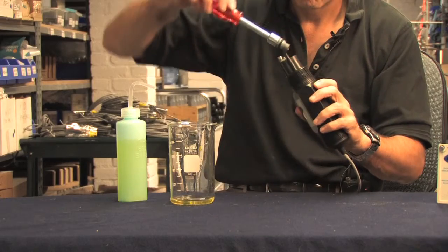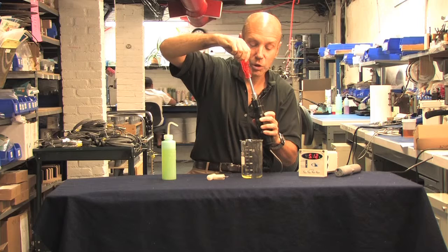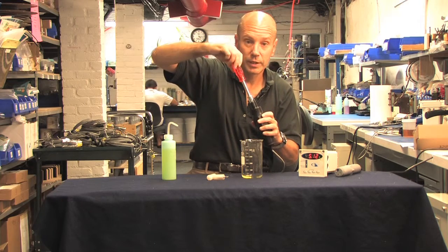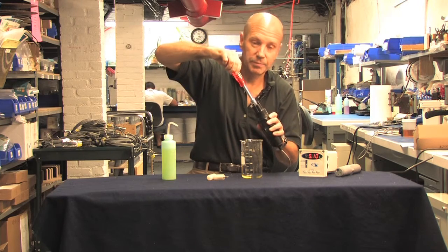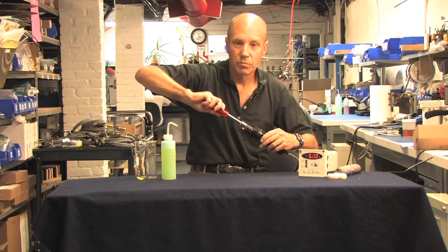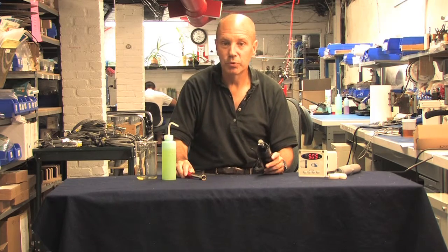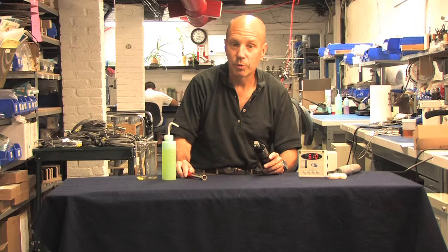What can happen is that the hydrostatic pressure of the salt bridge screwed against the liquid will cause the reference electrode to break, and that's going to make you cry. Screw the salt bridge in about hand tight and you're done. Now that you've changed the solution, you'll need to recalibrate the probe. If you need a refresher on doing that, just check out video number 3. When you do the calibration, check the efficiency. Hopefully you will see that it has improved.